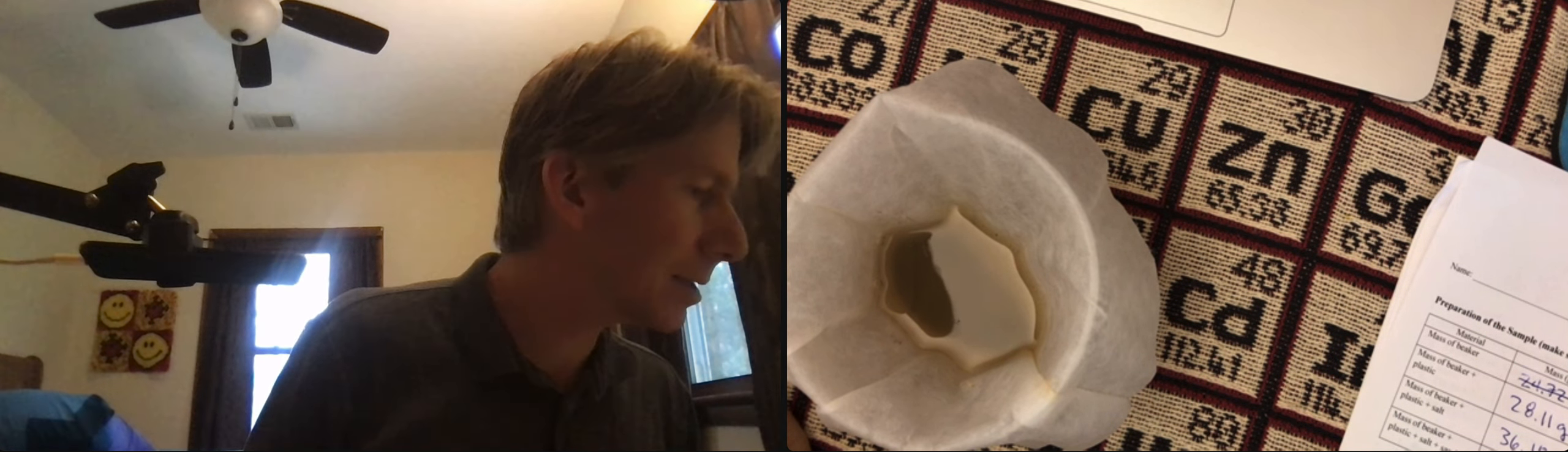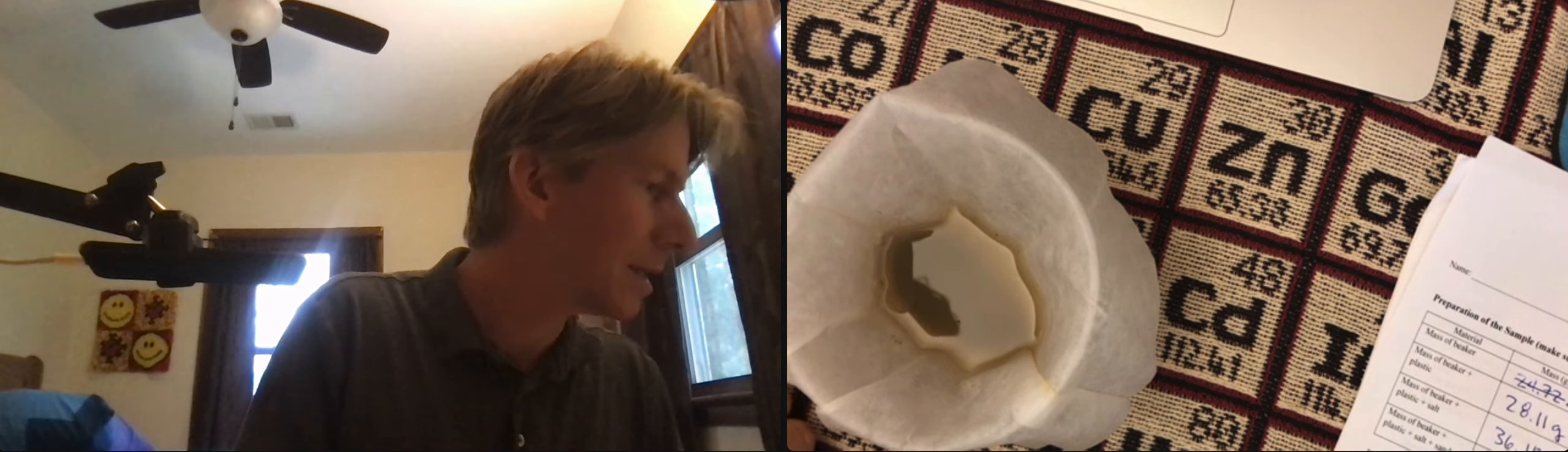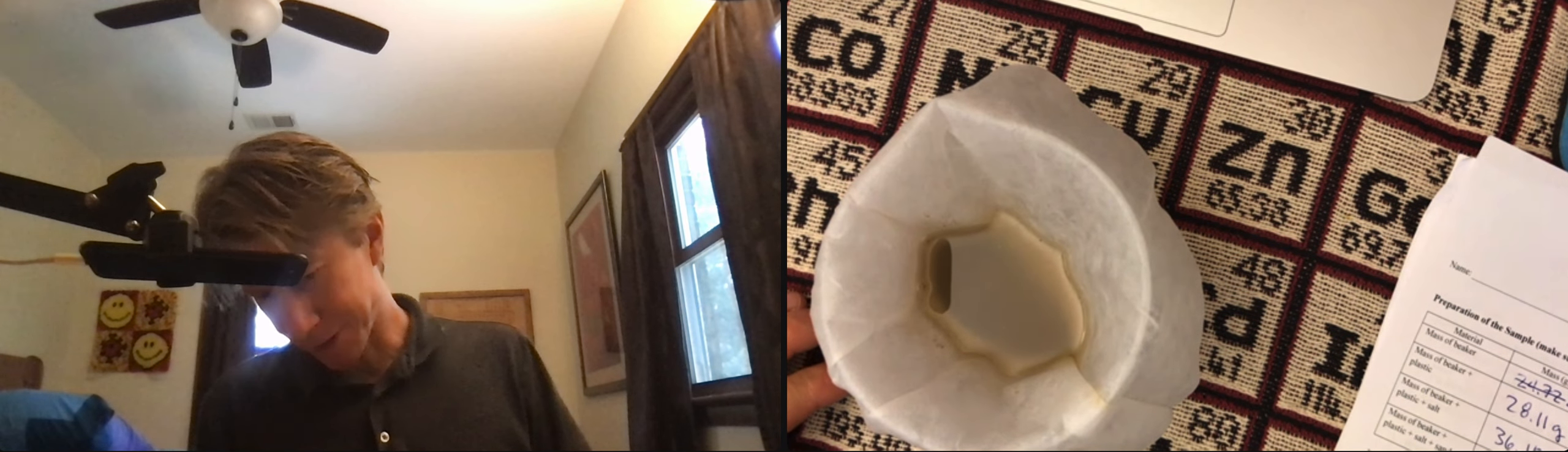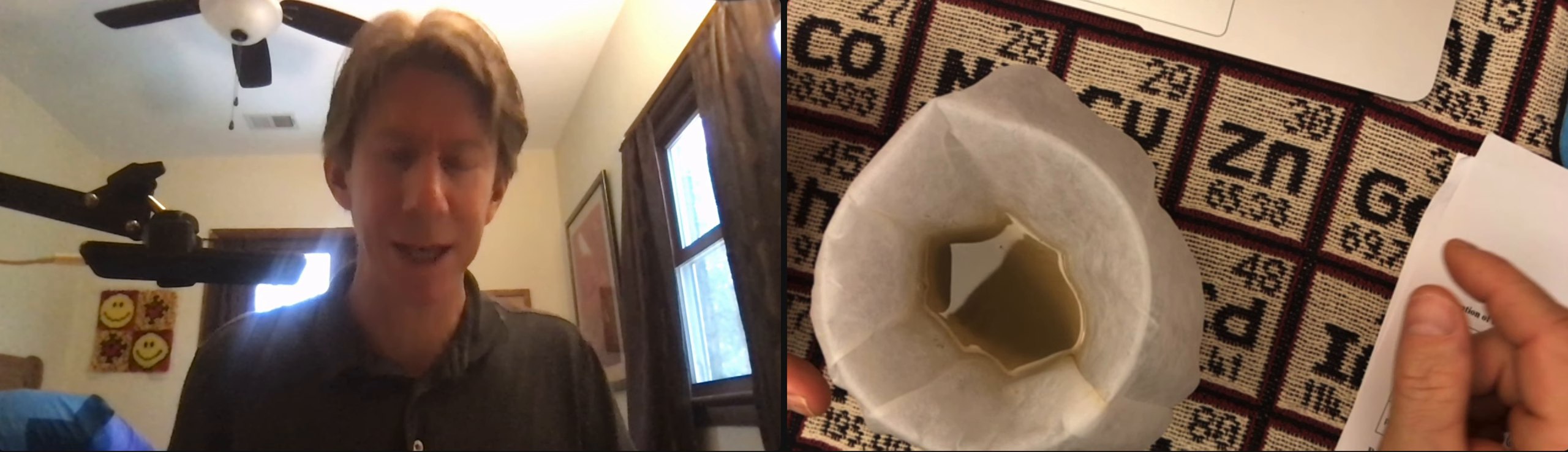And take a picture of the filter paper. All right. So you're going to want to take a picture from above, and a picture from the side, just showing what it looks like at this point.